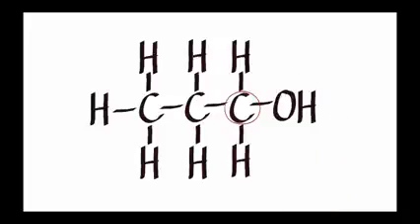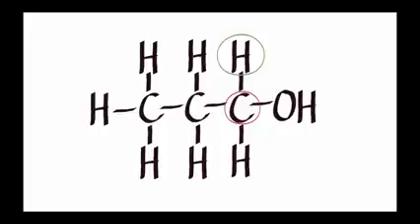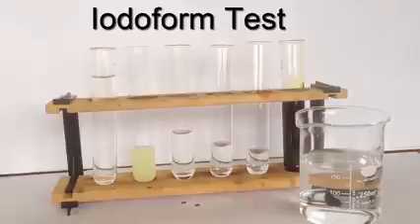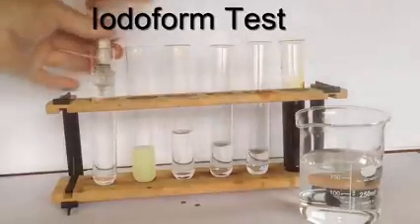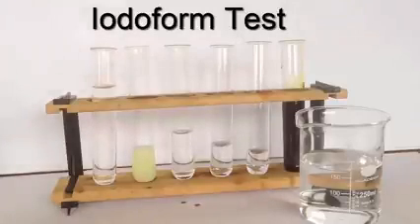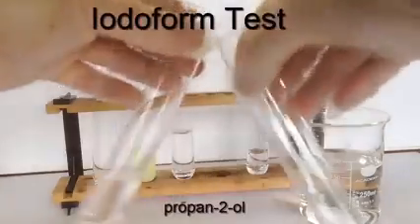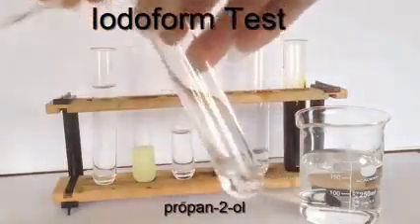There's the key carbon in question that's attached to the OH. Well, it is indeed attached to an H, but you'll see it's not attached to CH3. It has an ethyl group instead of a methyl group, so that was the correct result, negative. Let's move on to the positional isomer of propan-1-ol. That's propan-2-ol.